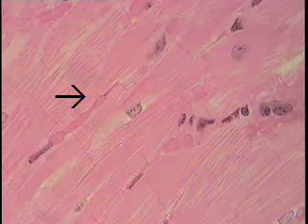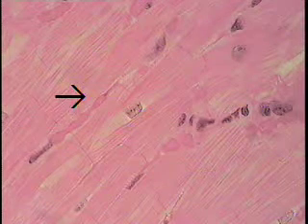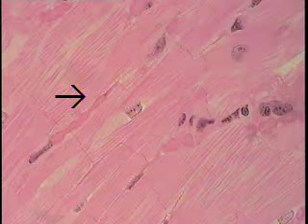Look at slide number 29 for cardiac muscle. Cardiac muscle makes up the myocardium of the heart, and is that type of muscle that enables the heart to have a pump-like action. And compare this type of striated muscle to that of skeletal muscles making up the limbs.